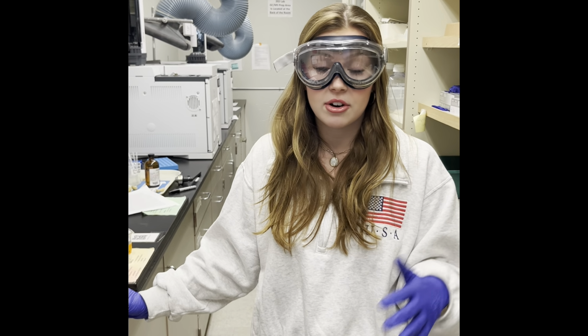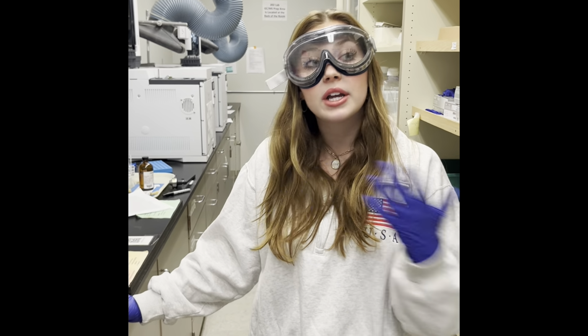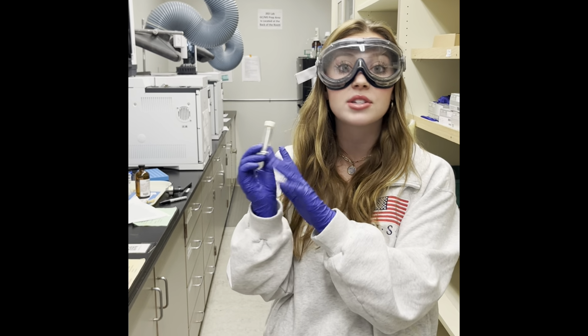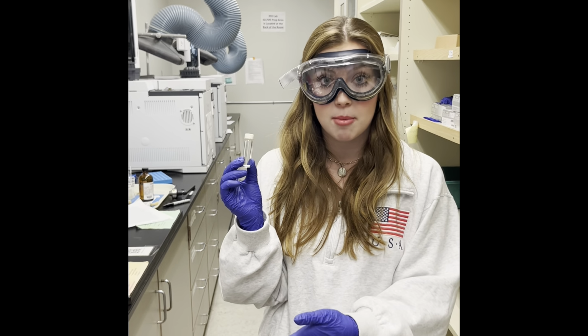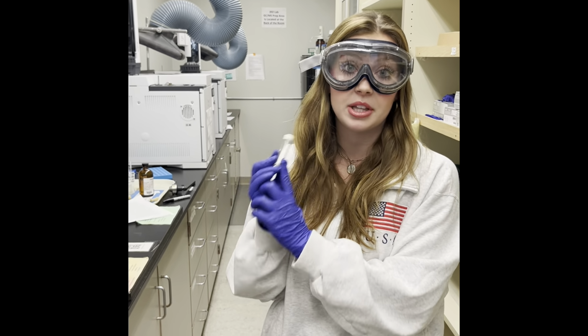In the worst case scenario, if somebody lost your sample or if your results didn't come through properly, it's important to make sure you keep your vials for every lab project you do, so if you need to run a new HNMR or CNMR, you have the ability to do so.